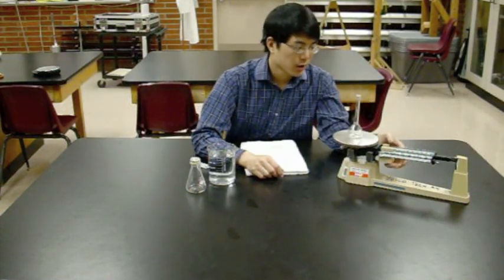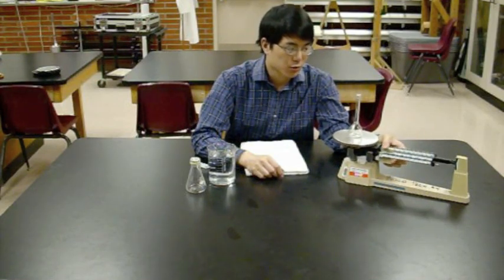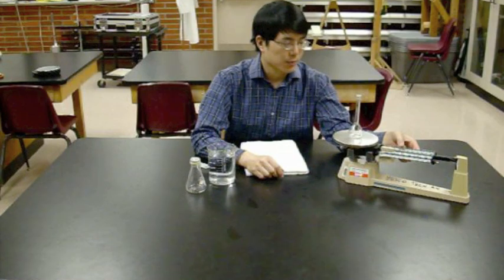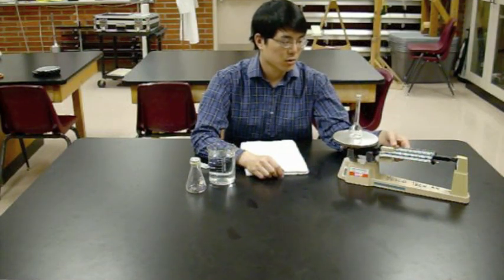Just put it on there, and start with the heaviest slider. 100 grams is too much, so we'll have to move in smaller increments. That's too much. That's still too much. Still too much.